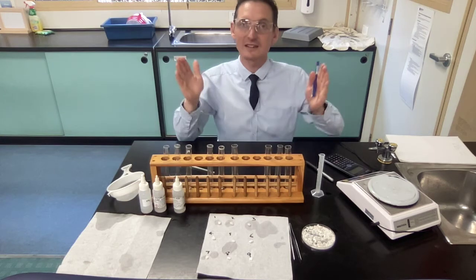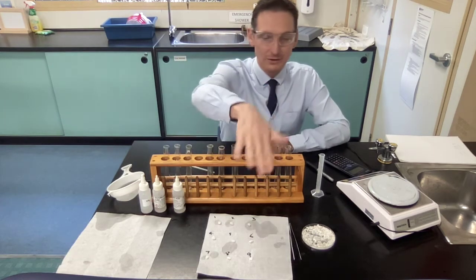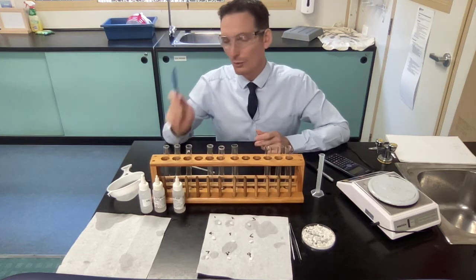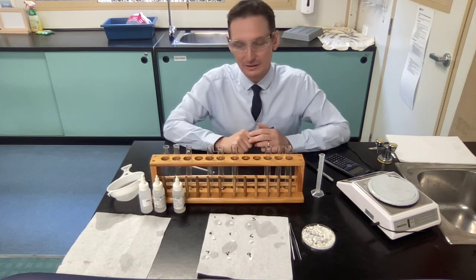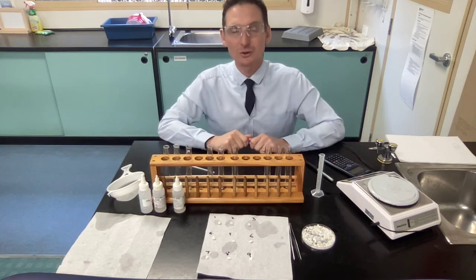Remember, graphing is a summary of what you're trying to find out. You have these 3 acids and some rocks. What is the difference between this acid, this one, and this one when they weather rocks? All right, that's your demo. Good luck.